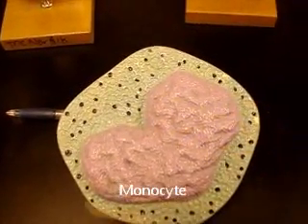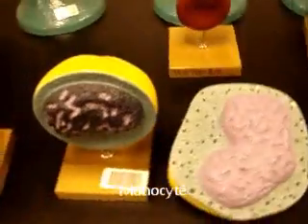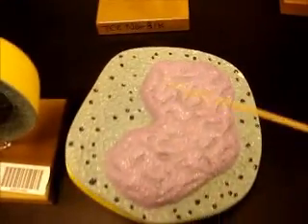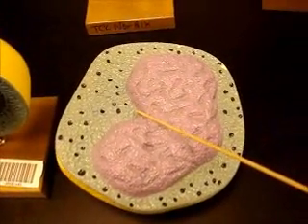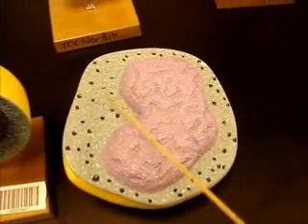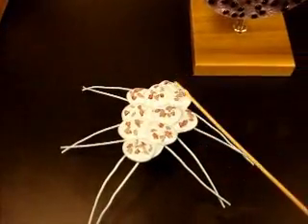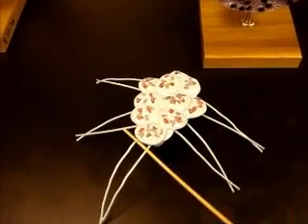The only other cell we have is a monocyte, right here. It's a very large cell if you compare it to a lymphocyte. Kidney bean shaped nucleus and not a whole lot of granules in the cytoplasm. This little guy right here that looks like a spider is your platelets that have clumped together — so this is thrombocytes.